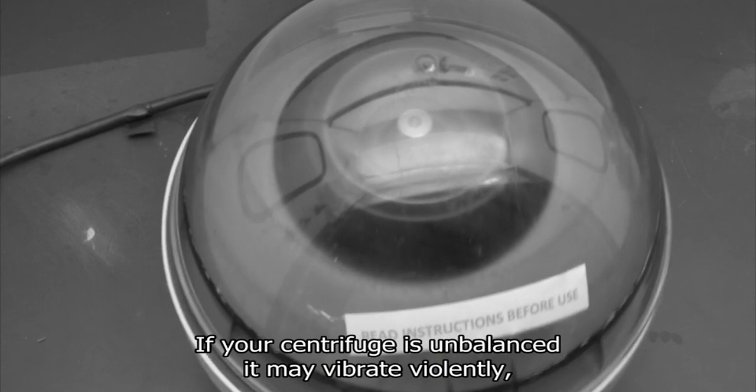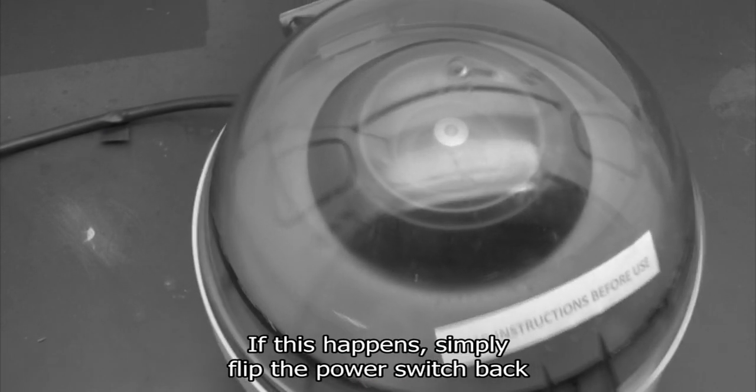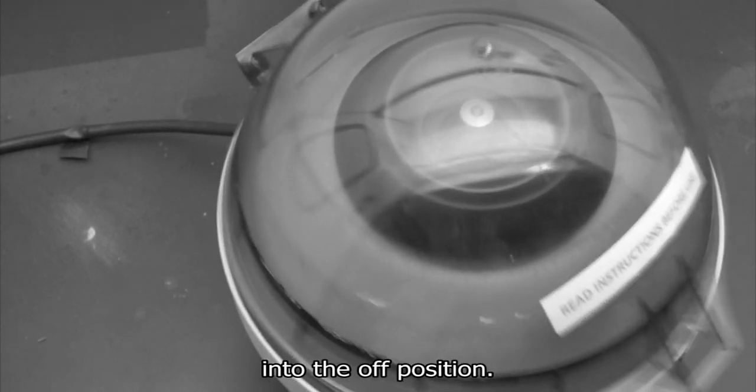If your centrifuge is unbalanced, it may vibrate violently and could cause damage to the machine. If this happens, simply flip the power switch back into the off position.